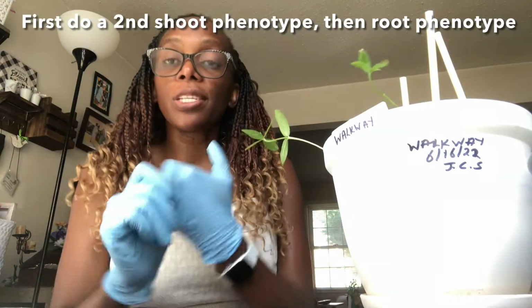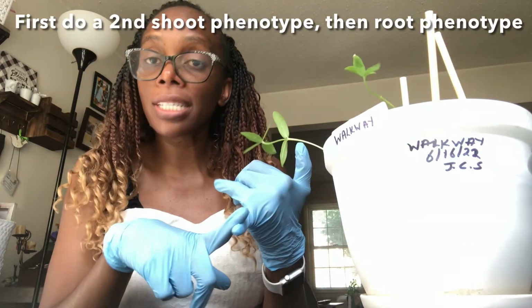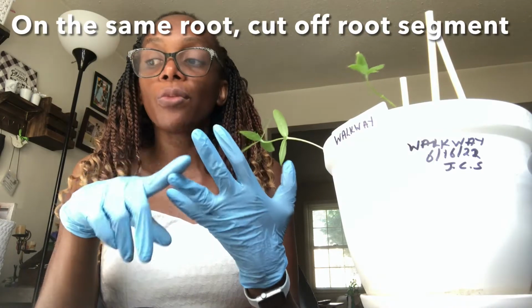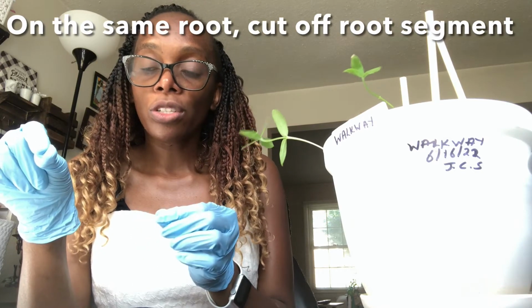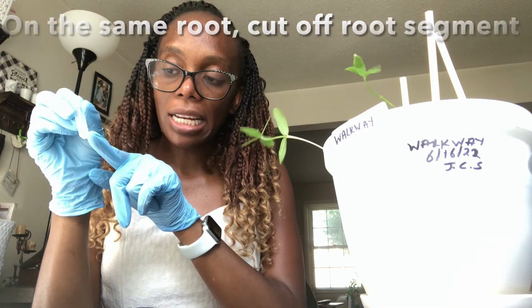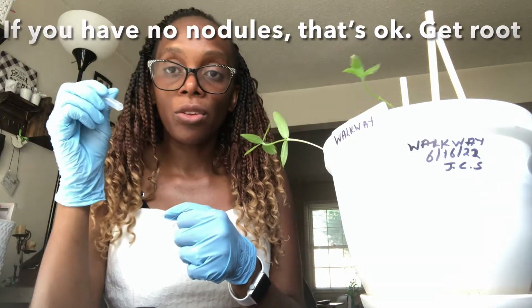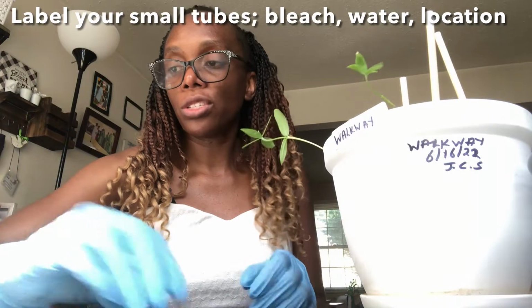We need to get our plants, and the first thing we have to do is do a shoot phenotype. You already know how to do this. And then do a root phenotype using a microscope, and then on the same root cut off a segment that has nodules, or as many nodules as you can get that will fit into the tube, just near the bottom. If you don't have any root nodules, just get a big enough segment, and then you add it in your tube. Okay. So first things first, let's label our tubes.